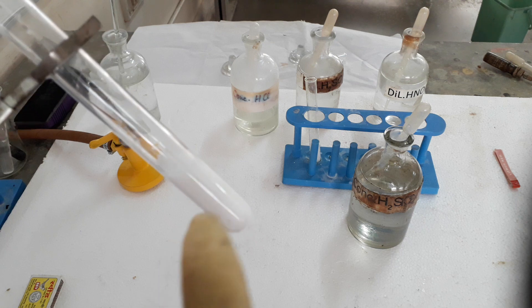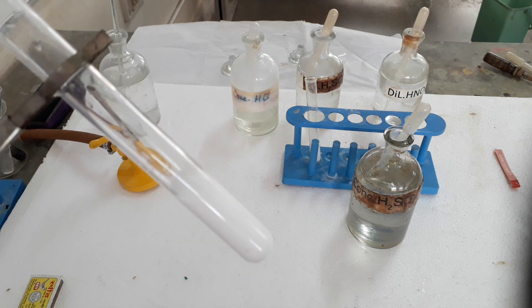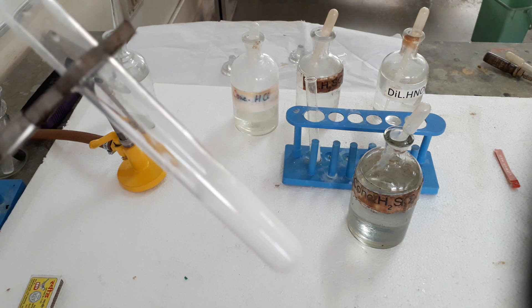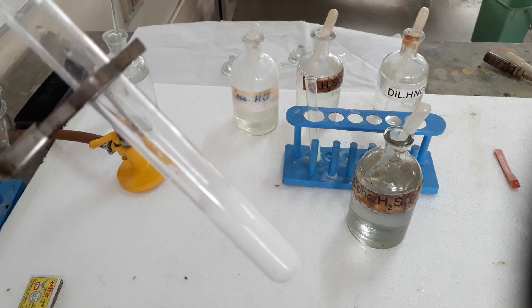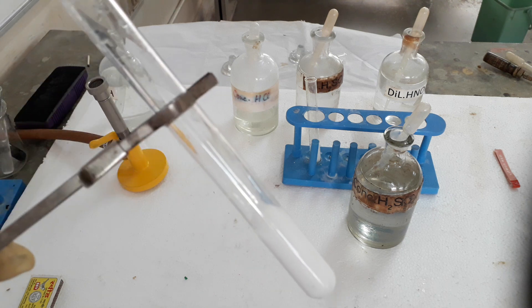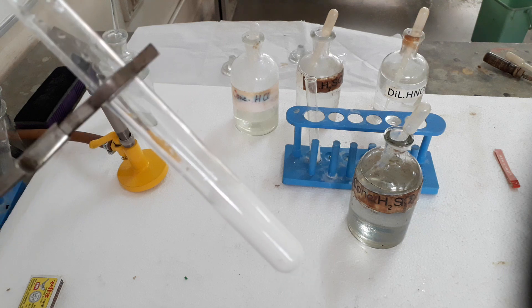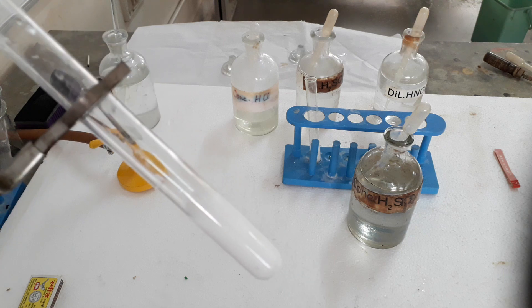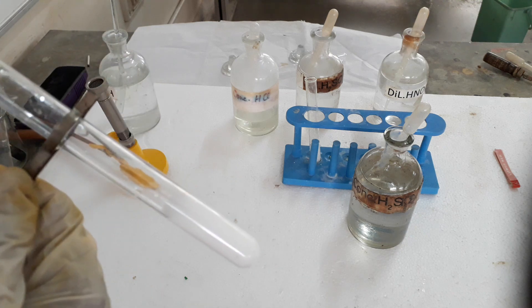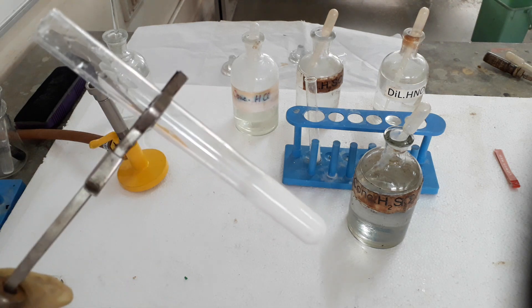Barium chloride reacts with sulfuric acid to give barium sulfate, BaSO₄, which is insoluble in nitric acid (HNO₃) or HCl. This confirms that the solution is dilute sulfuric acid — this is the test for dilute sulfuric acid.